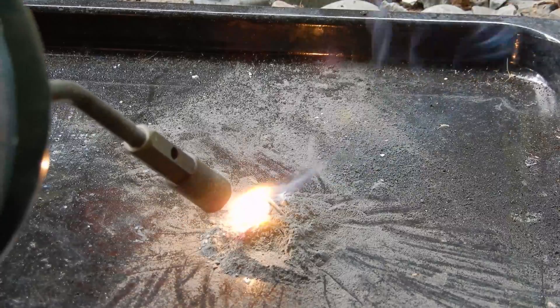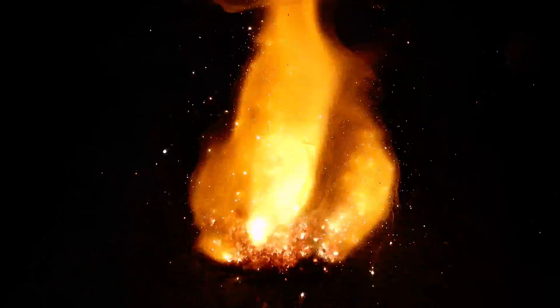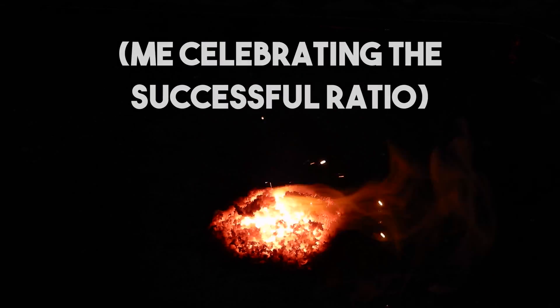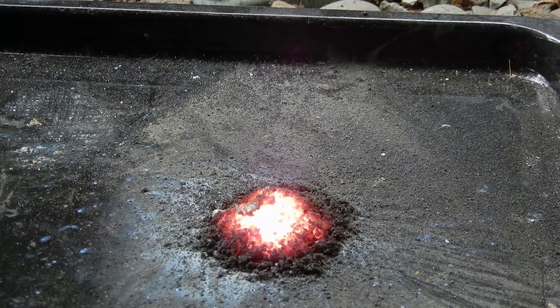I'm going to light it now. Hell yeah! 0.6 grams made that difference, guys. Hell yeah. I can't see it all. Woo!